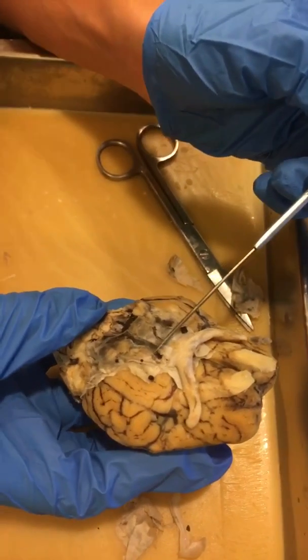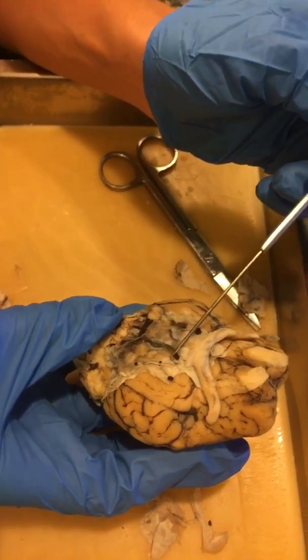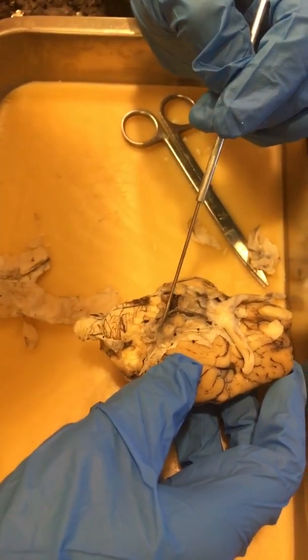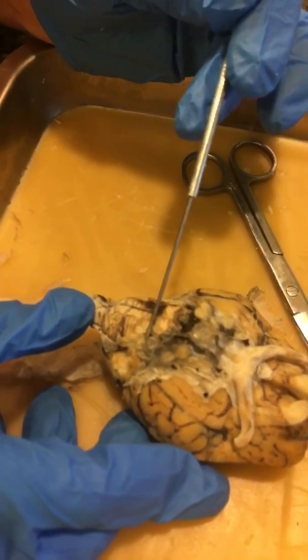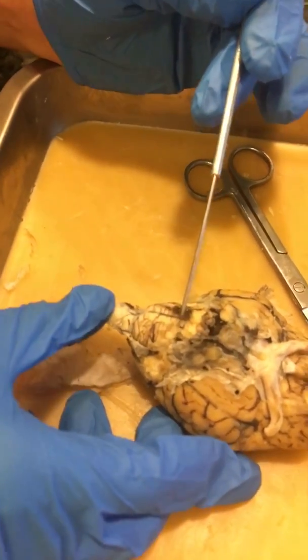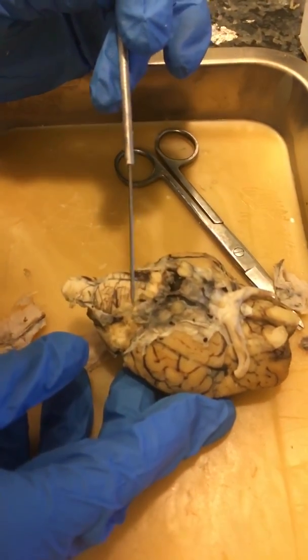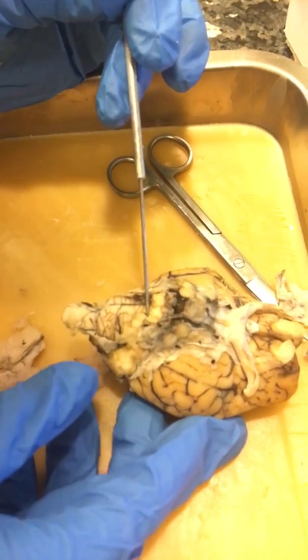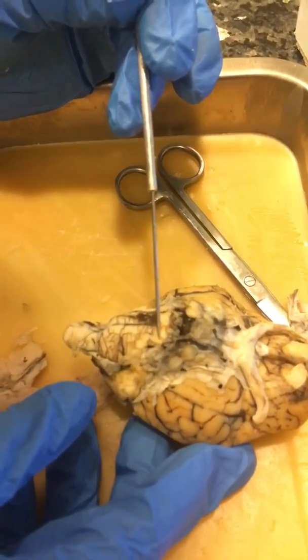For cranial nerve 3, we have the oculomotor. For cranial nerve 4, the trochlear, it's not visible, but it would be somewhere in this region. For cranial nerve 5, the trigeminal, it should be in this region. And the abducens is right here — this tiny little thing right here.